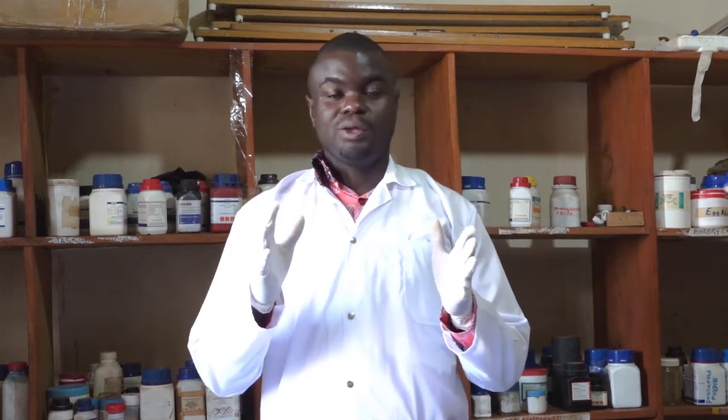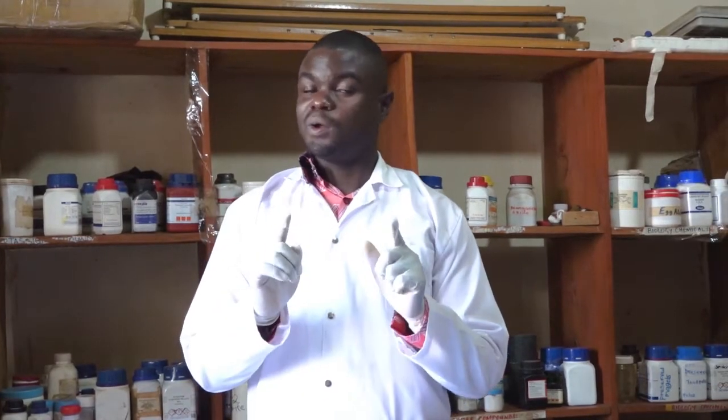Again, you are welcome to our first episode of Homo Best Learning. Today we are to demonstrate how to test for the presence of starch in a given solution.